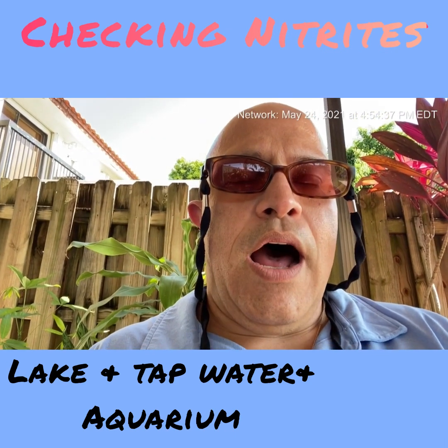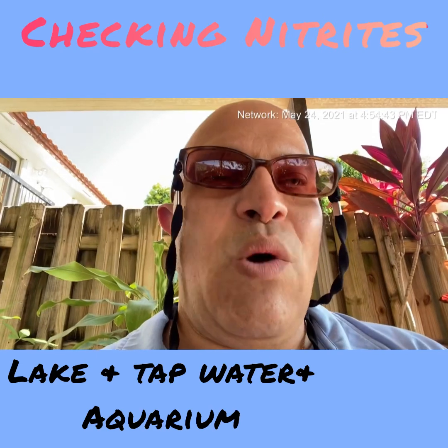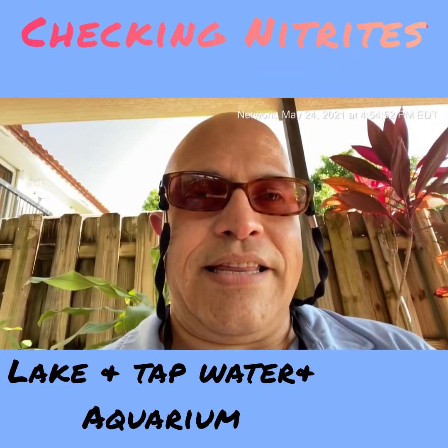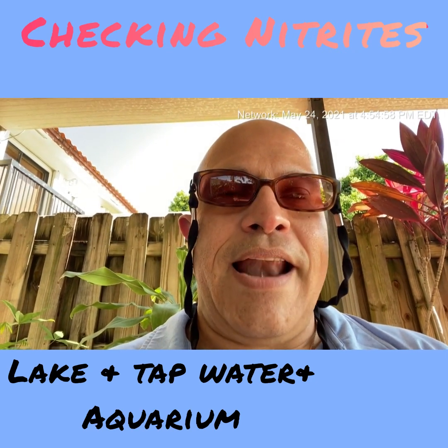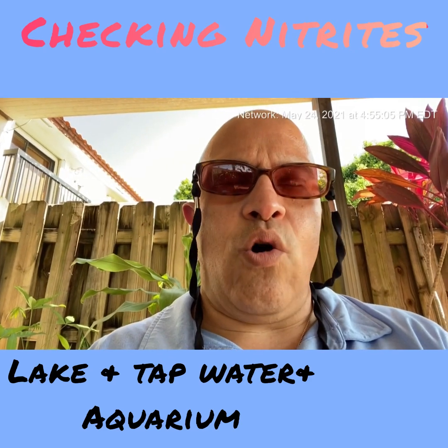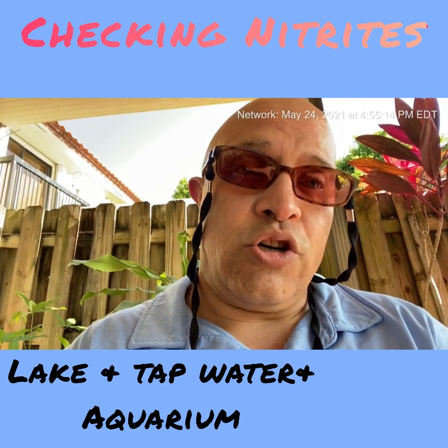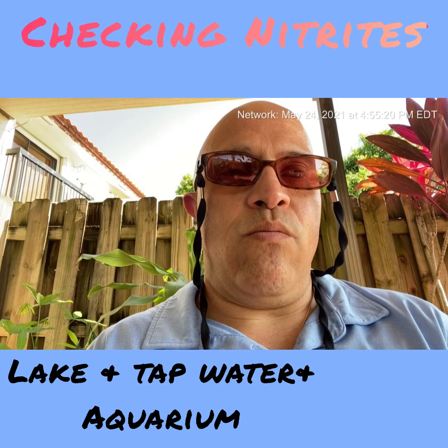I'm a big believer in following directions. Some people just throw in some drops and see what happens — but no, follow the directions. I like the theme of connections: following directions applies whether it's college-related or fish-related. Doing things right gives you a more accurate picture — in this case, the quality of your water and the health of your fish.